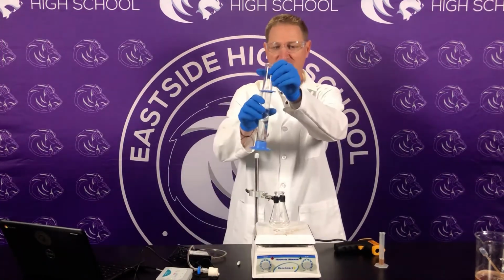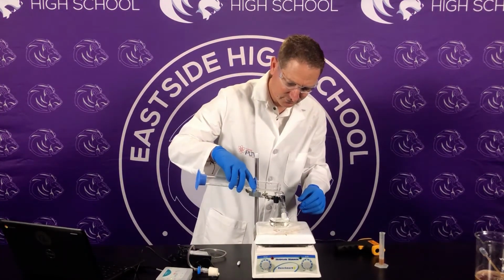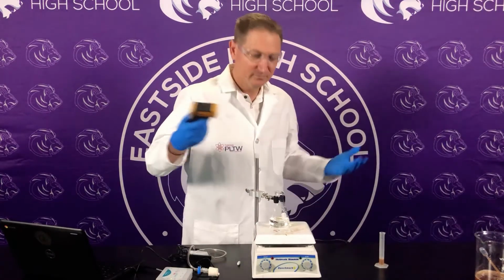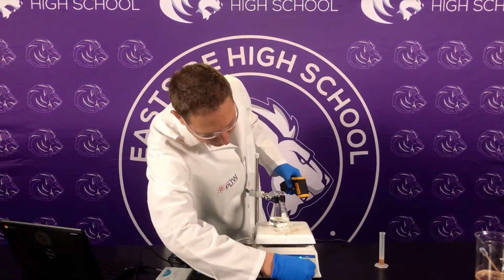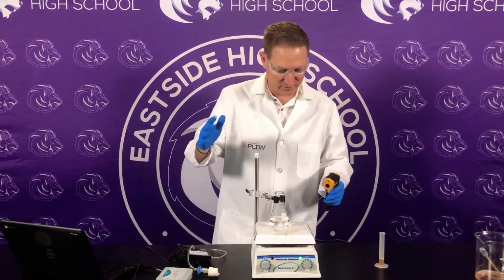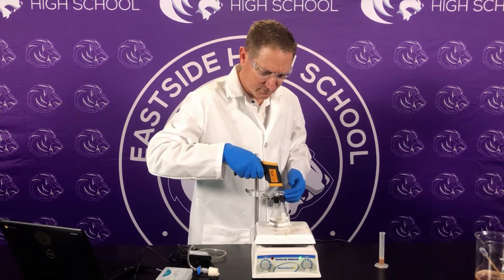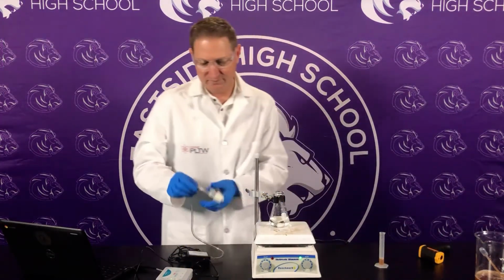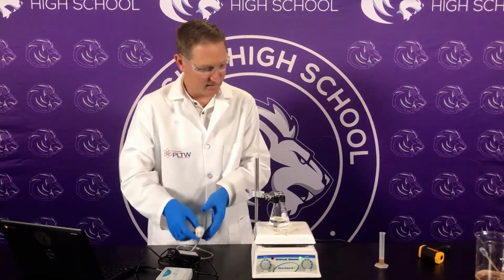So I have 50 mLs, just like in the last two. And I'm going to take the temperature. Actually, I'm going to put the stir bar in because I did that last time. Exact same way. Let's try and keep everything consistent. Stir on 5, just like the last two. .4. Okay, pretty consistent. So again, make sure it's closed off. Just double check everything. Make sure they're tightened down.